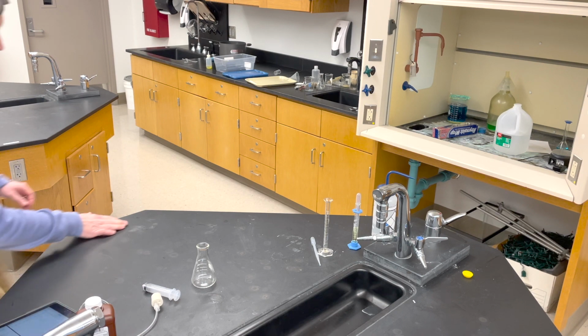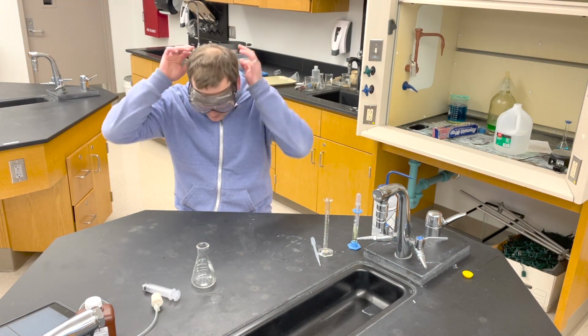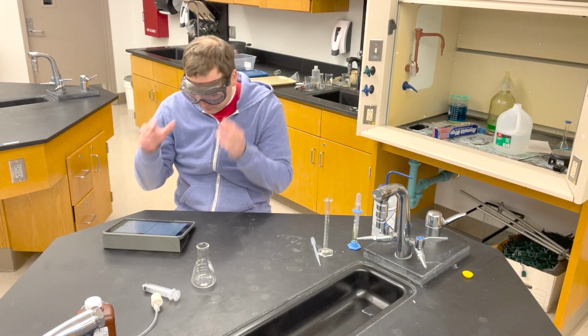Hey everybody, welcome to lab number 12. We're going to see if we can figure out the kinetics constant using hydrogen peroxide and potassium iodide.